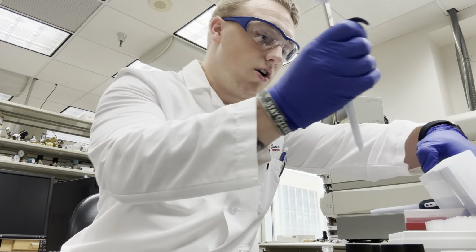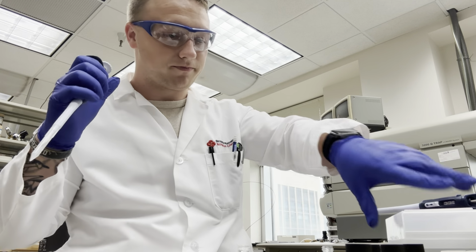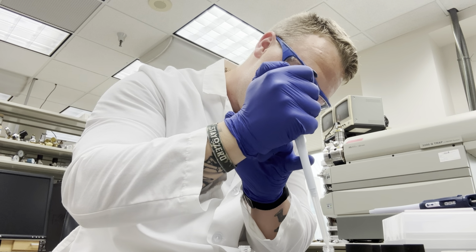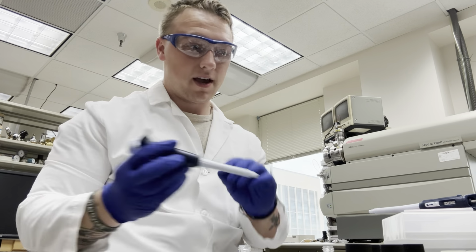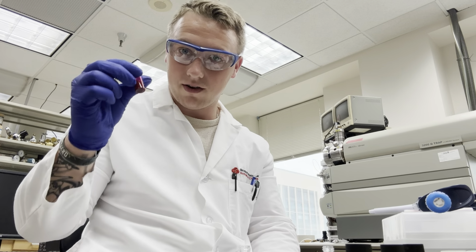I like to put in the solvent first, just in case. That's our 2,400, and now we're going to drop 600 from this.